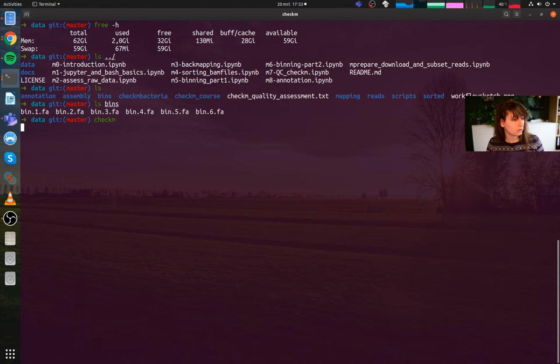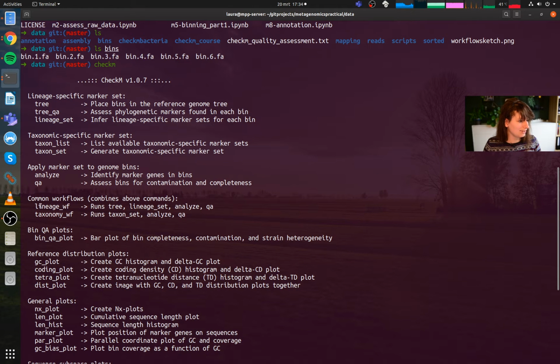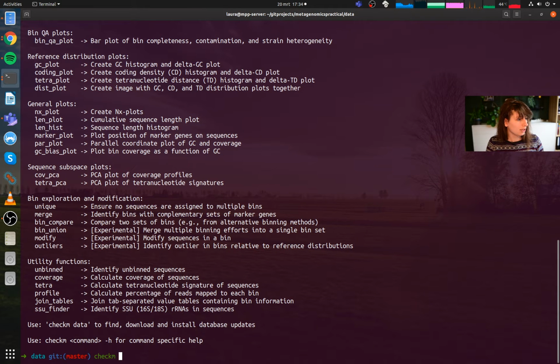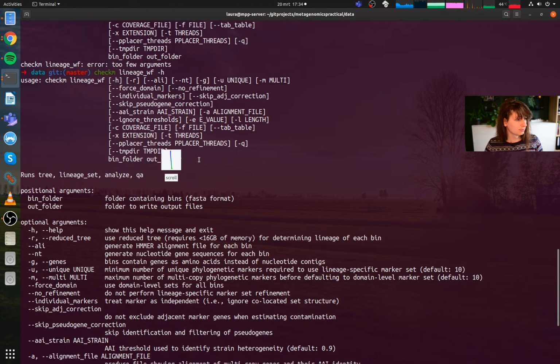And like always, you run it perhaps like this. There's a lot of information in there, and we're looking specifically at the lineage workflow. So what's nice about this, I'm first gonna run it and then I'm gonna talk. So CheckM lineage underscore WF, see what happens. It gives you an error, it wants you to do minus H. Sure, we do that. Run. It gives you usage. There we are. CheckM space lineage WF.